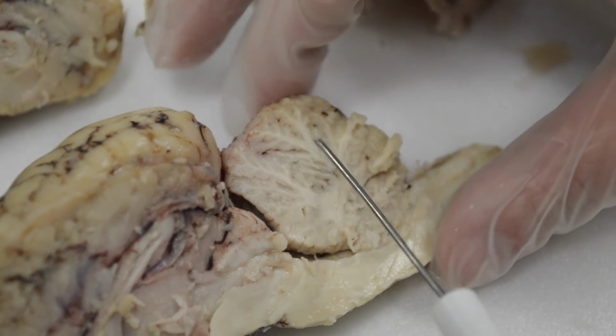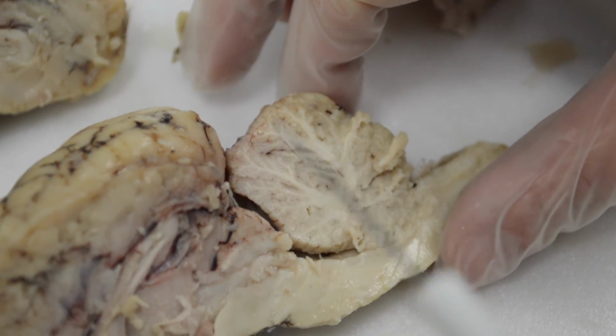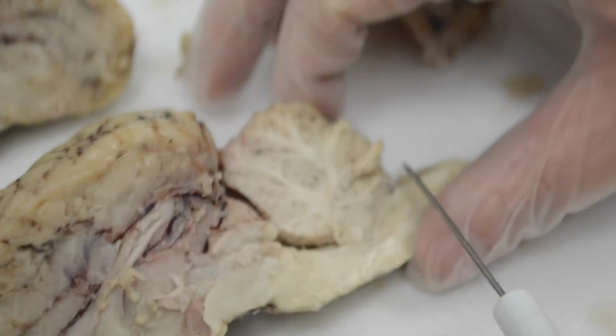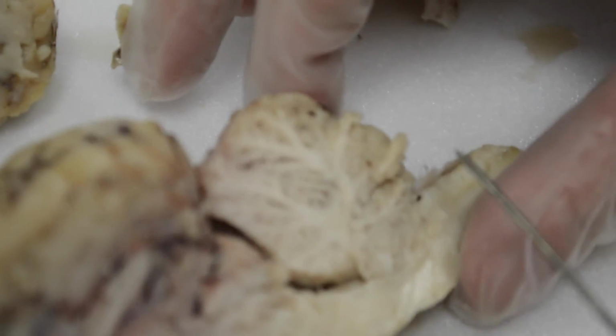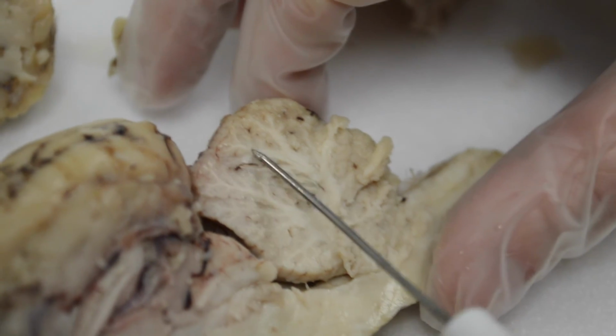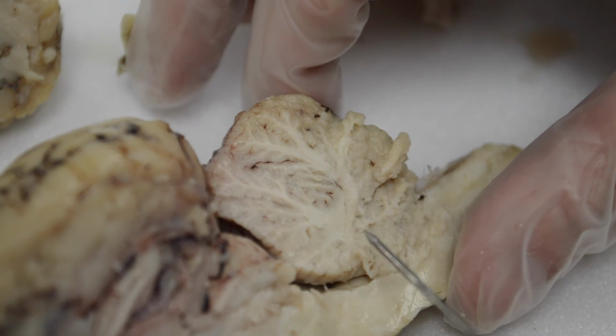And so they named it after how an actual tree looks. So this is the white matter in the center, and around it is the gray matter, and that's to represent the leaves, or what the technical term is folia, which also means leaves. So the gray matter is the folia, the white matter is called the arbor vitae.